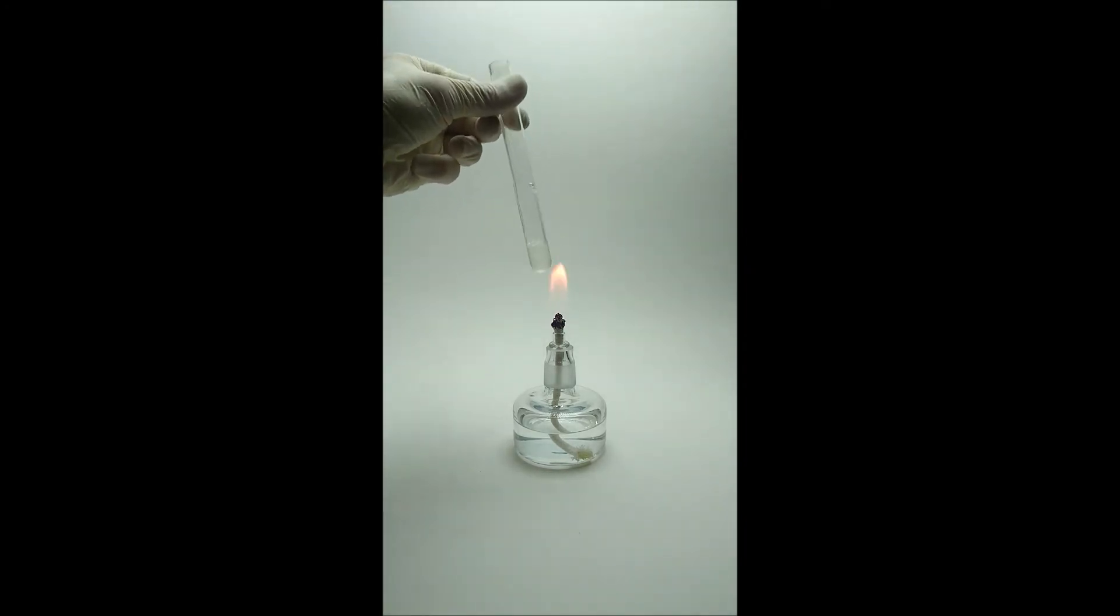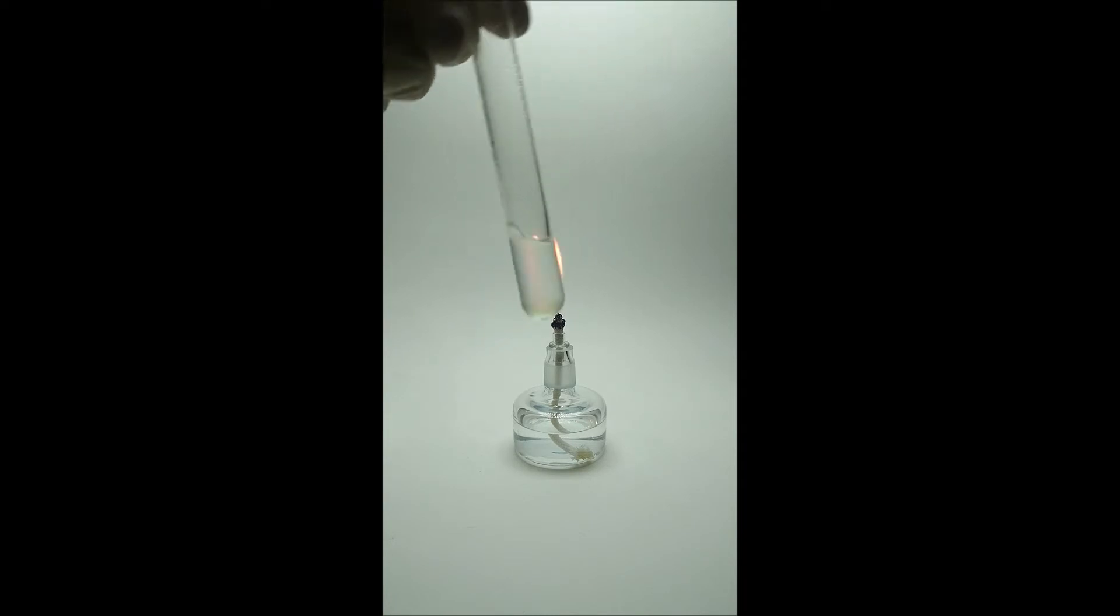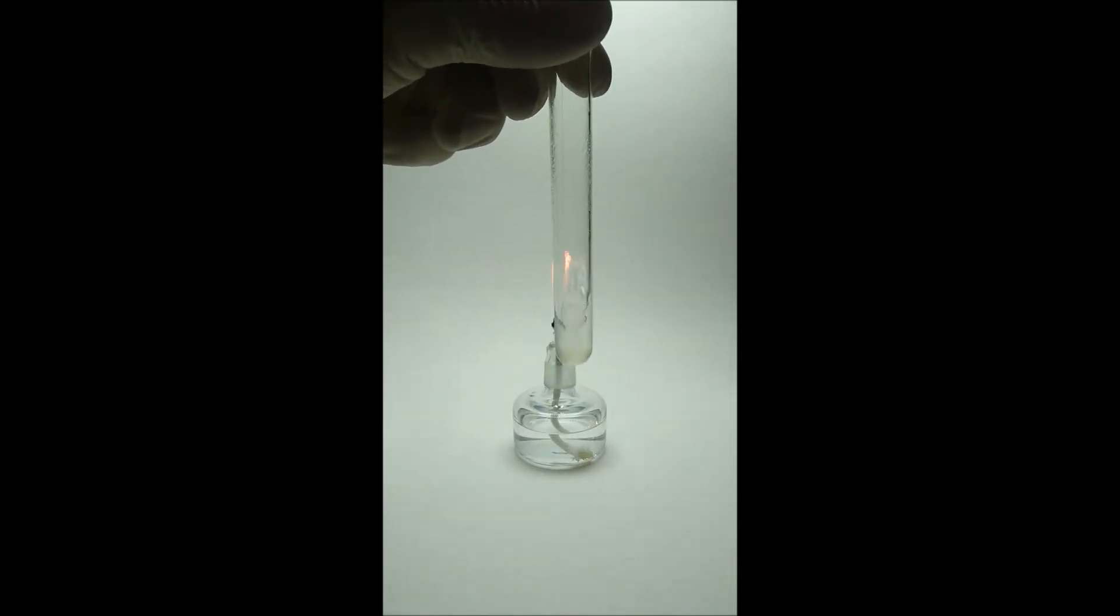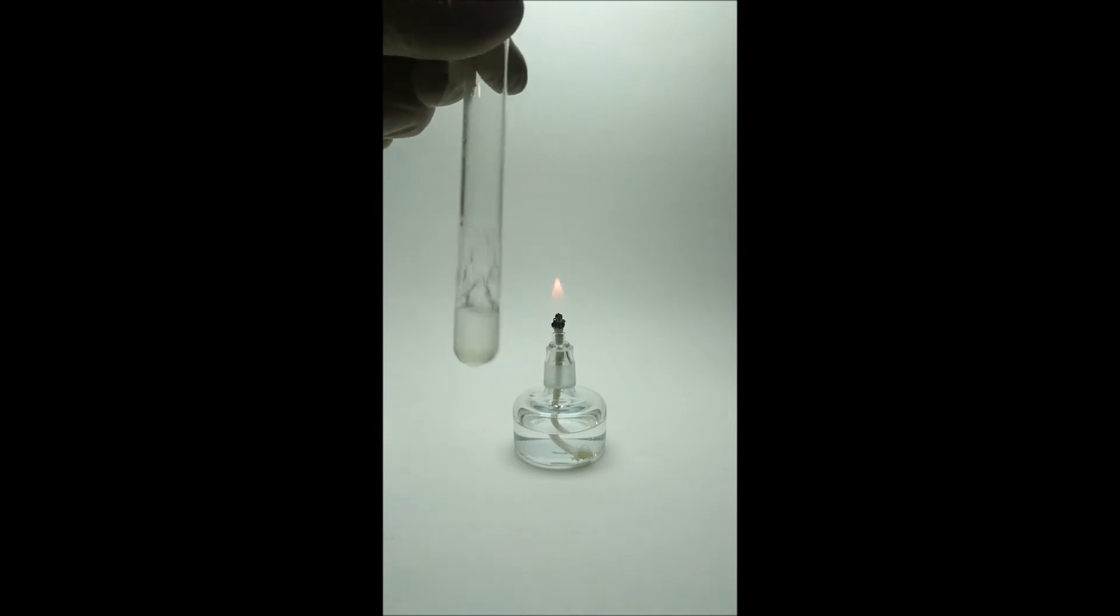Check periodically if the layers are separating and if you can see two individual layers. You can stop heating and let the solution cool.